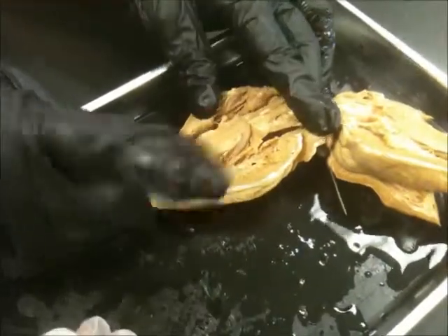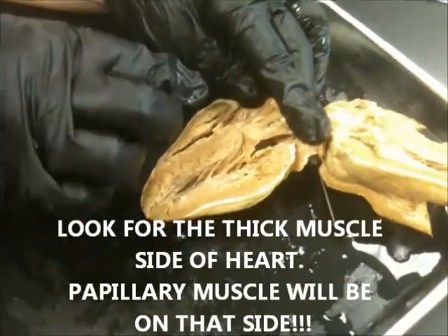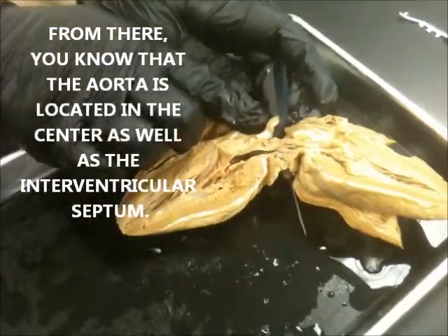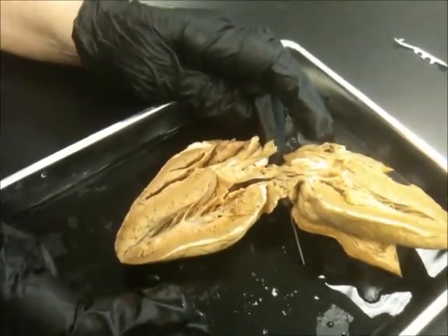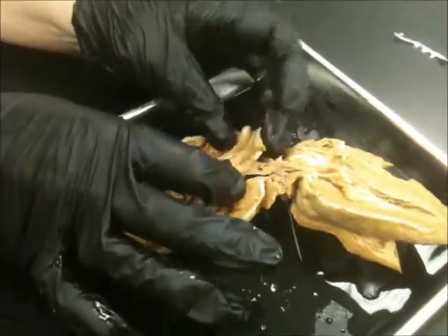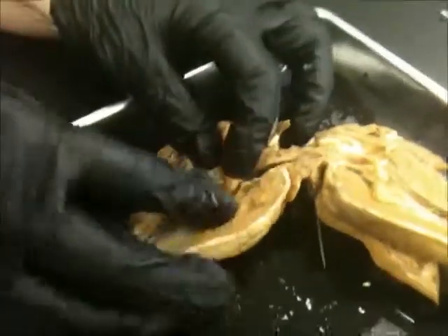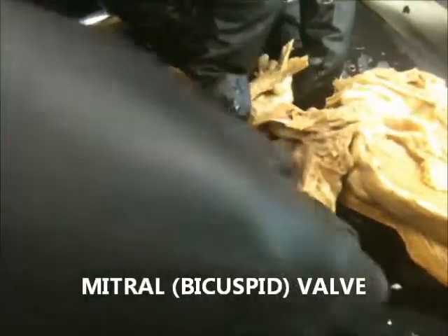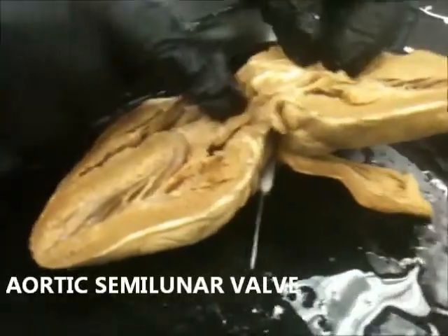When you're only looking at one side, you're going to look at the way this is pointing, and also the size of the papillary muscle and the thickness of the wall. So we'll know this is right and this is left. The aorta is basically going to be in the center, right here. Knowing the orientation — which is the bicuspid and the tricuspid — then you find the aorta and know where the aortic semilunar valve should be. So this is the mitral valve here, and the semilunar is going to be up here because it's got to be pumped through the aorta.